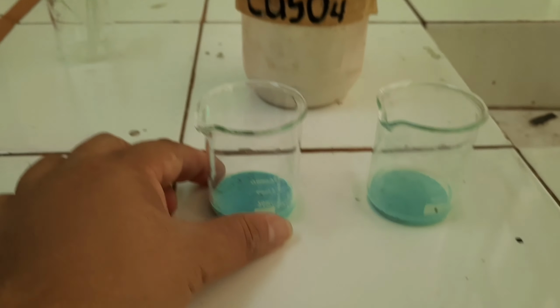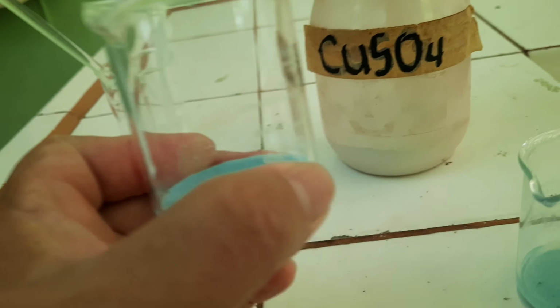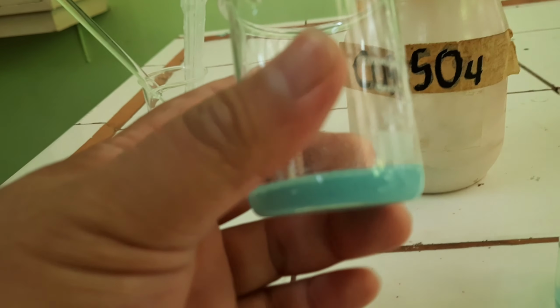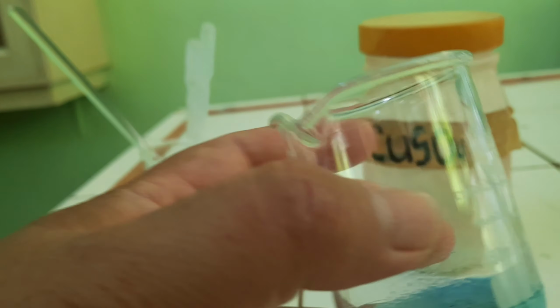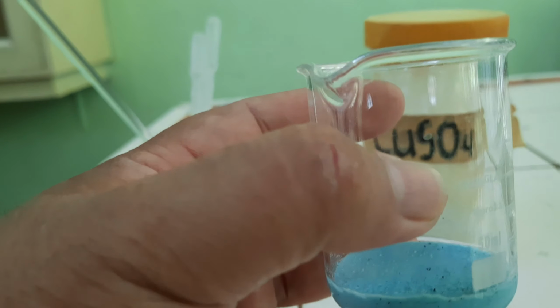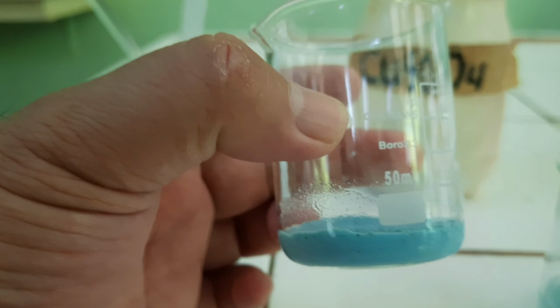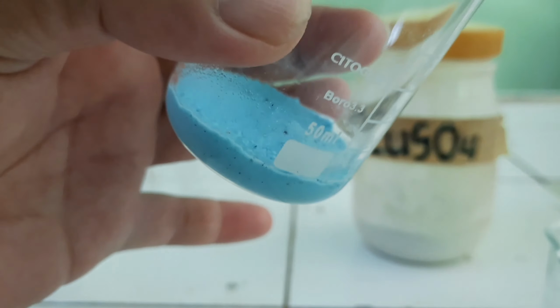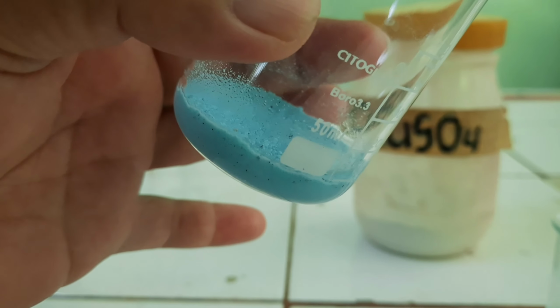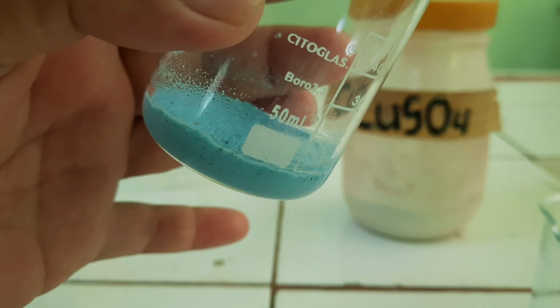in the dilute alcohol solution, the copper sulfate added turned blue, absorbing the water therein. And it's almost dry, considering that probably there is a very small amount of alcohol in that solution. So the alcohol remaining in this beaker is quite very small in amount.